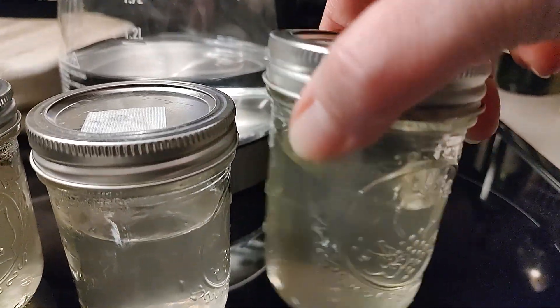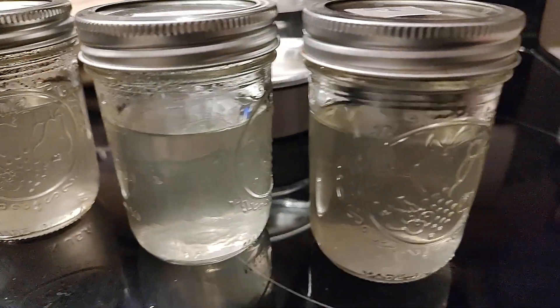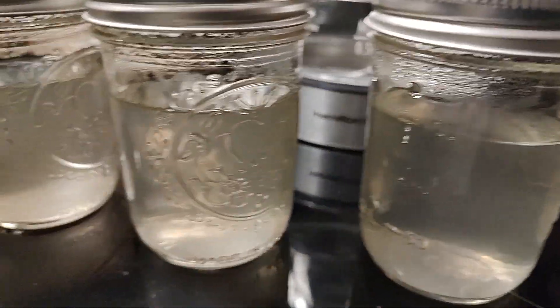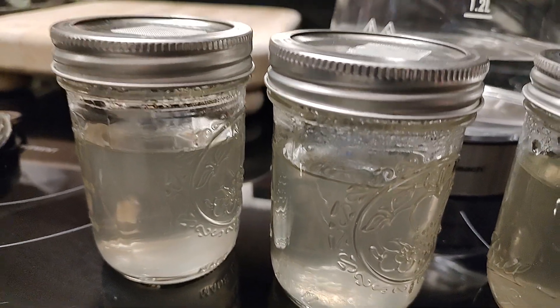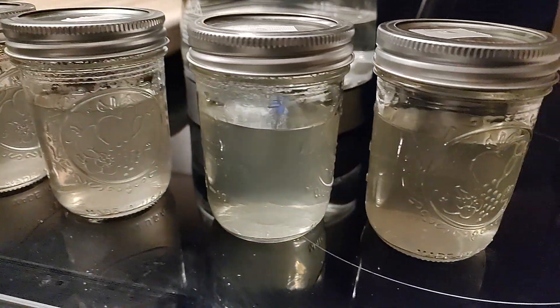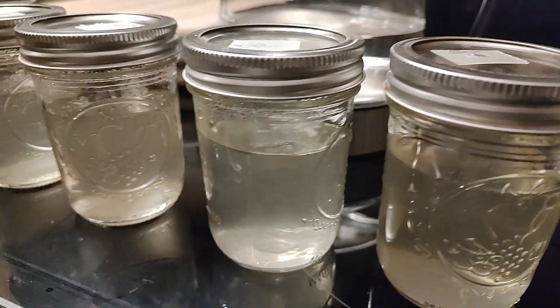They have a long-lasting shelf life. We like to do four or smaller — this is 150 milliliters — to spread out the risk. Just in case something goes wrong, we prefer to have more jars than fewer.